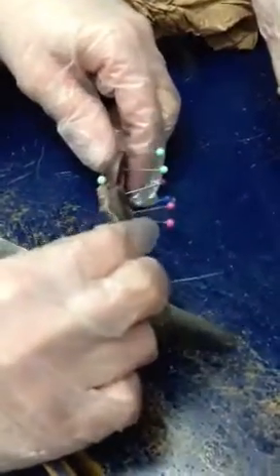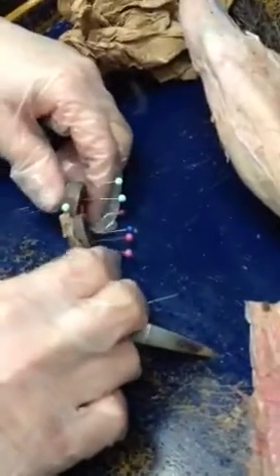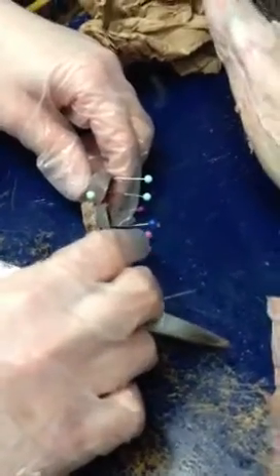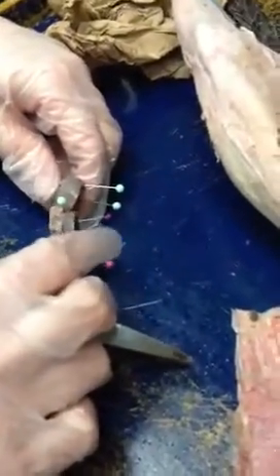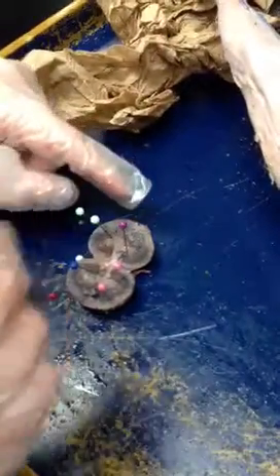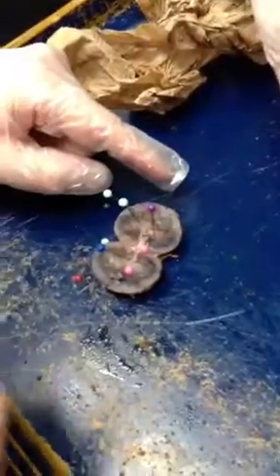All right, the red one. The cortex. Oh, that's the outside. The renal capsule. So it's just a layer, yeah. On the inside we have two layers. We have this outer layer, which is the renal cortex, and then this one is the renal medulla. Okay, I'm going to take these out.